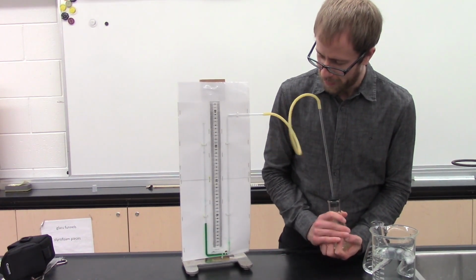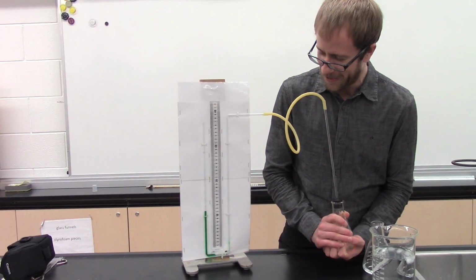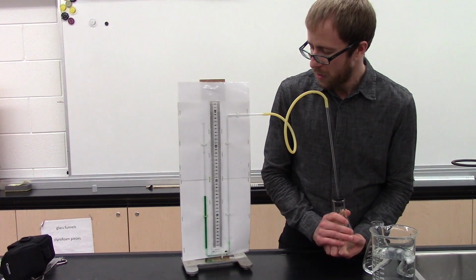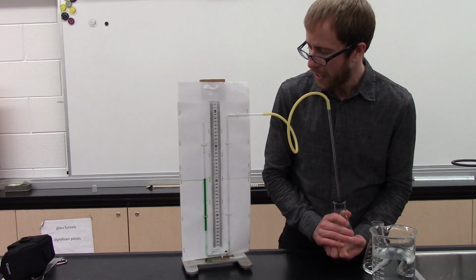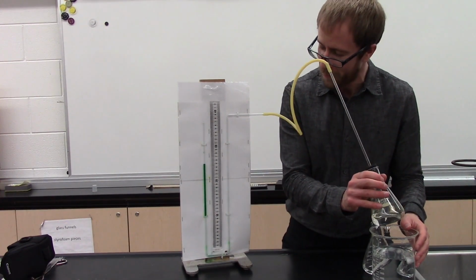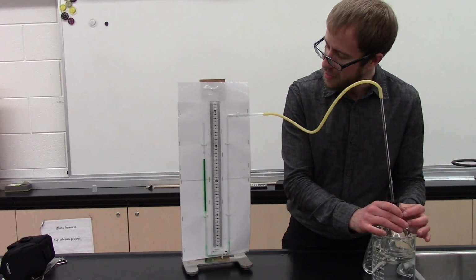So if I heat this one up with my hands, there you go, it's shooting up pretty quick. So the acetone, being much more volatile, has a much higher vapor pressure, and the vapor pressure goes up more rapidly with increases in temperature. I actually have a beaker here just in case so it doesn't shoot out the top. So this is a beaker of ice water. Watch what happens to the vapor pressure when I stick it in this beaker.